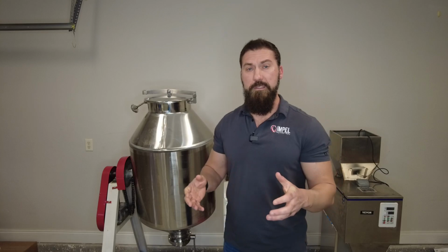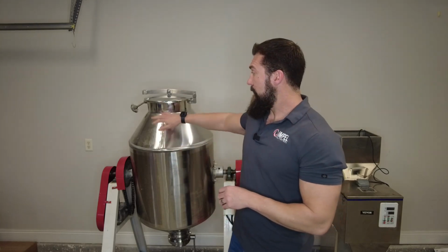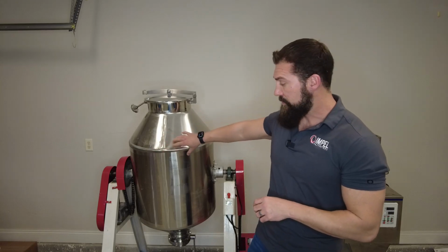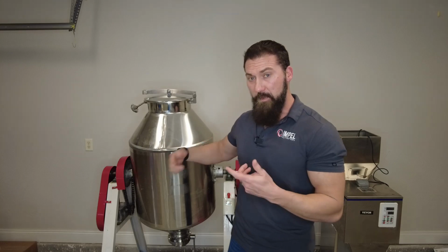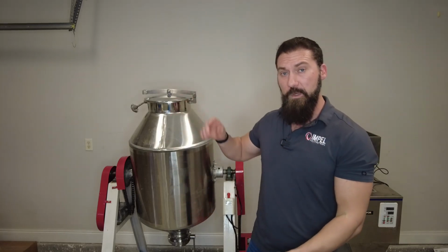So you are going to start with your raw materials and you will calculate them, as I will show you later, to create the batch size that is expected. A drum mixer like this is a 100-liter industrial size drum mixer. This has agitators in the middle with paddles that rotate in the opposite direction that the drum is spinning. So it will spin one way, the paddles on the inside spin the other way.